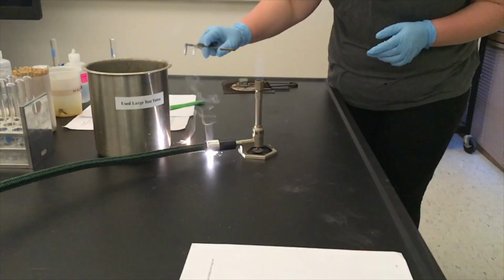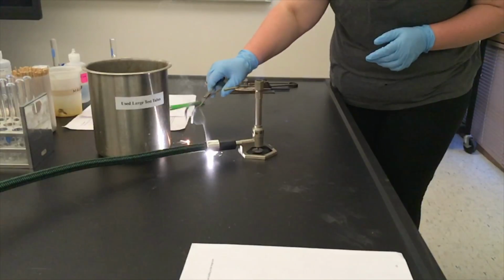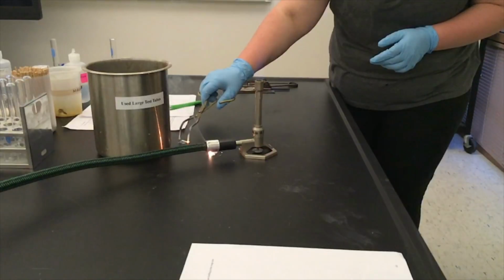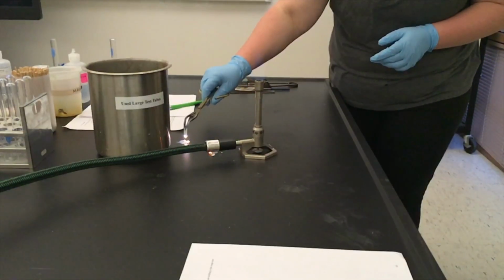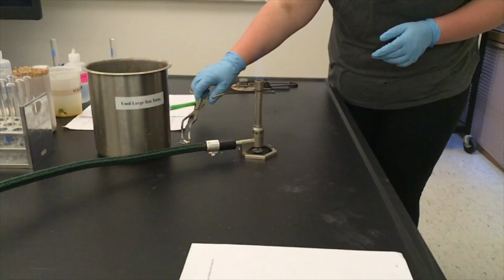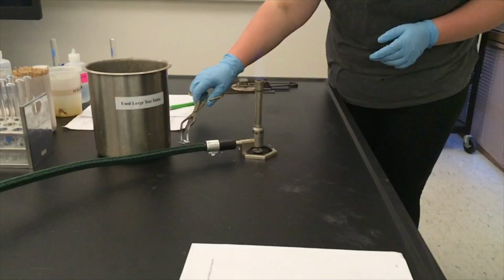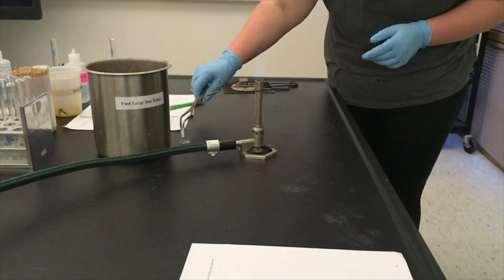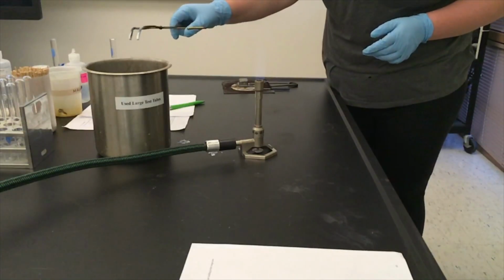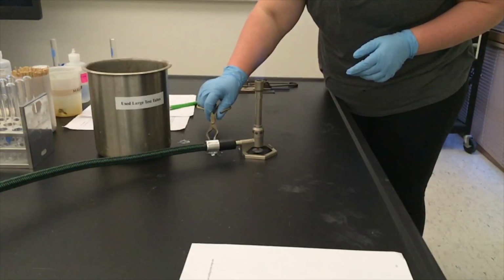This change in properties is a very good indication that we have actually had a chemical reaction take place. Also note that there is no way to easily convert the magnesium oxide, which is in the form of a white powder, back into the solid strips of magnesium metal which we started with.